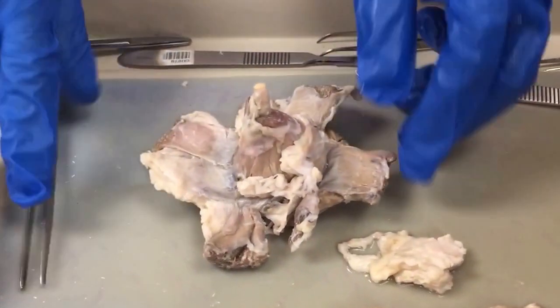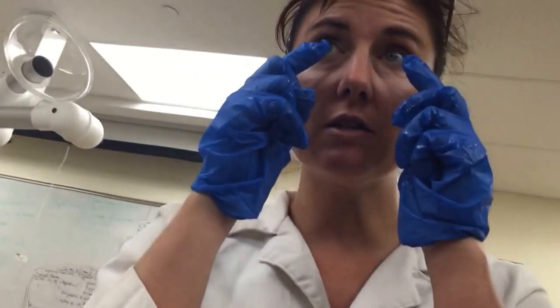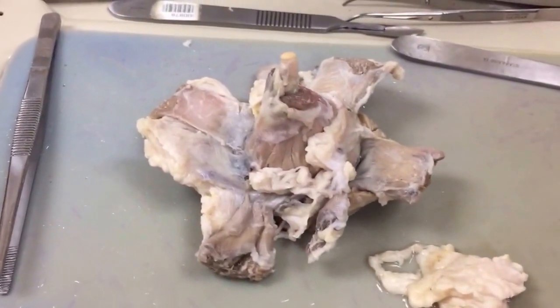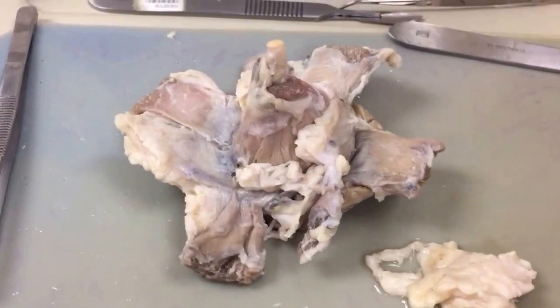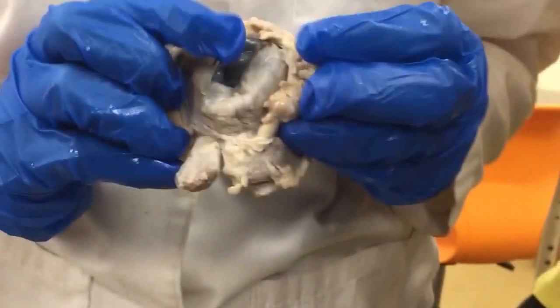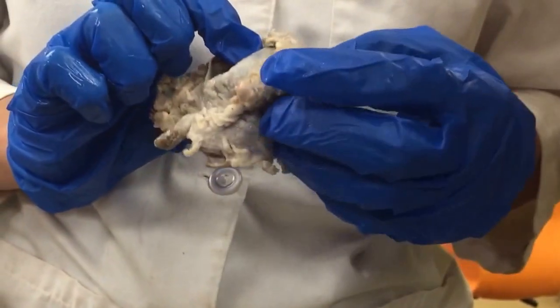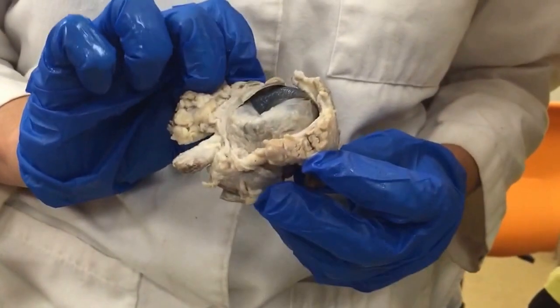Everyone see this? So the lacrimal, think about your lacrimal ducts, your lacrimal glands, are right in the corners of your eye, right? And the eyelid is more pronounced on the top side. So if you look at the cow eyeball from this side, you've got your eyelid here, and your lacrimal gland is on the front corner of the eye. Okay.